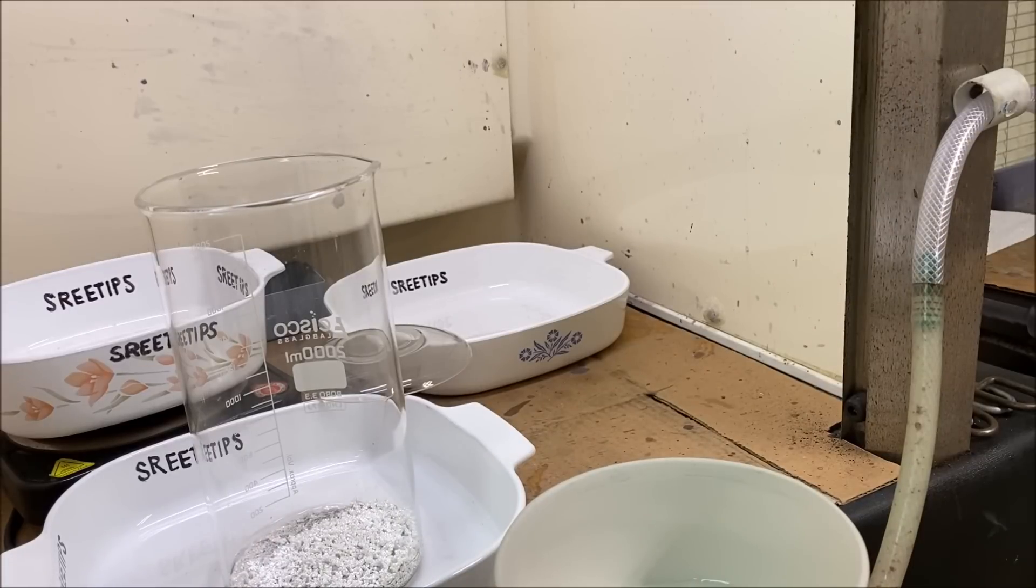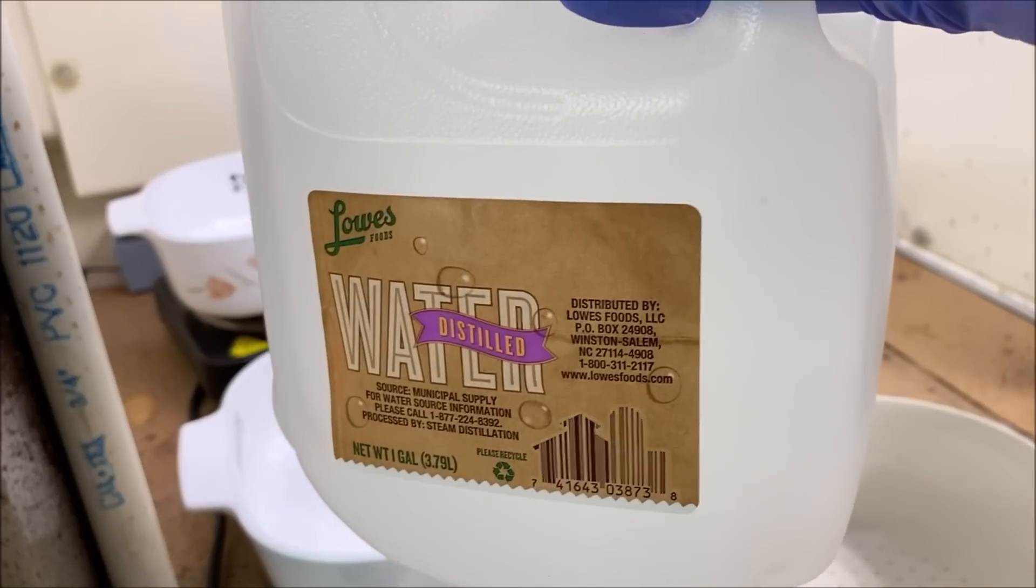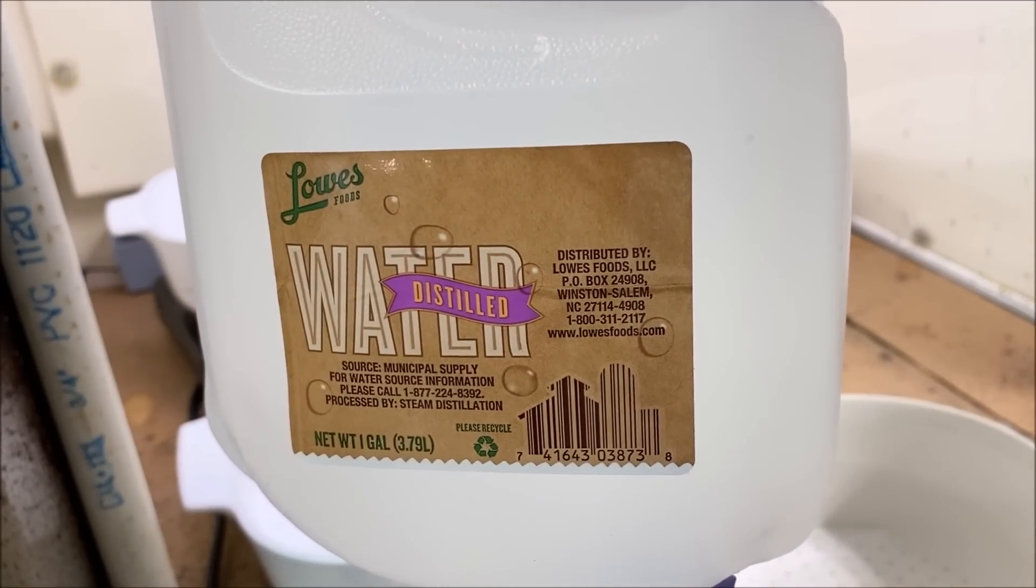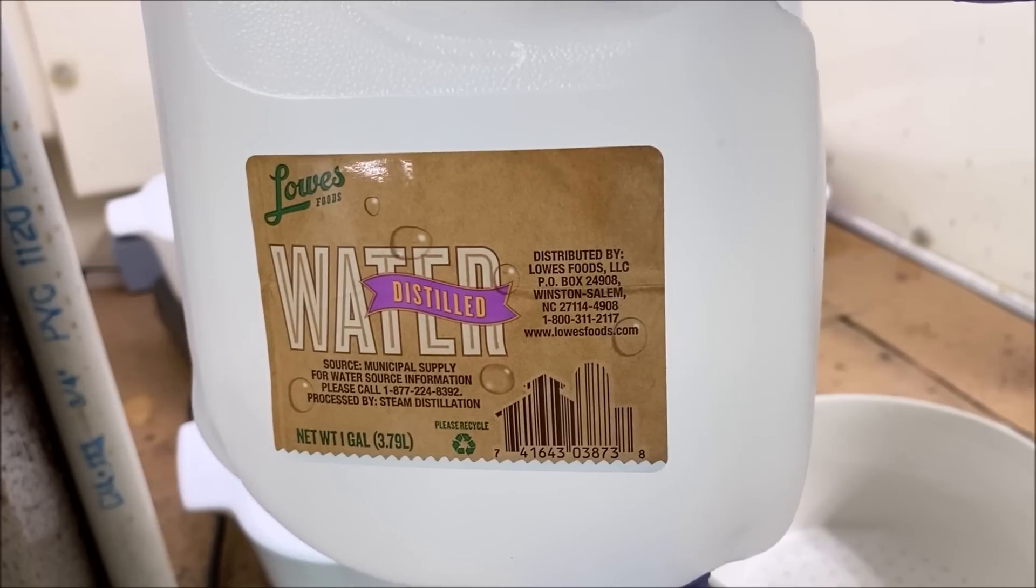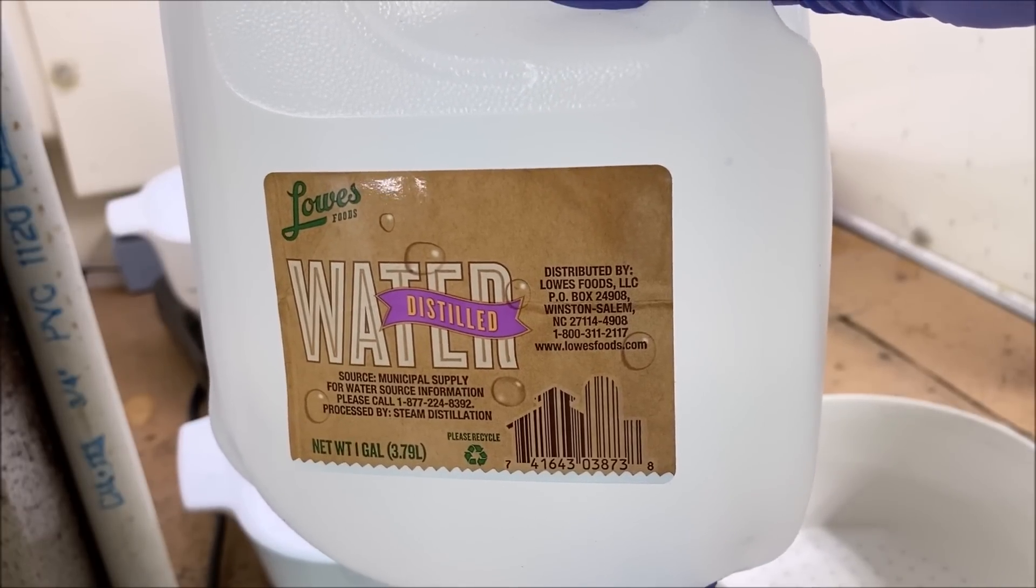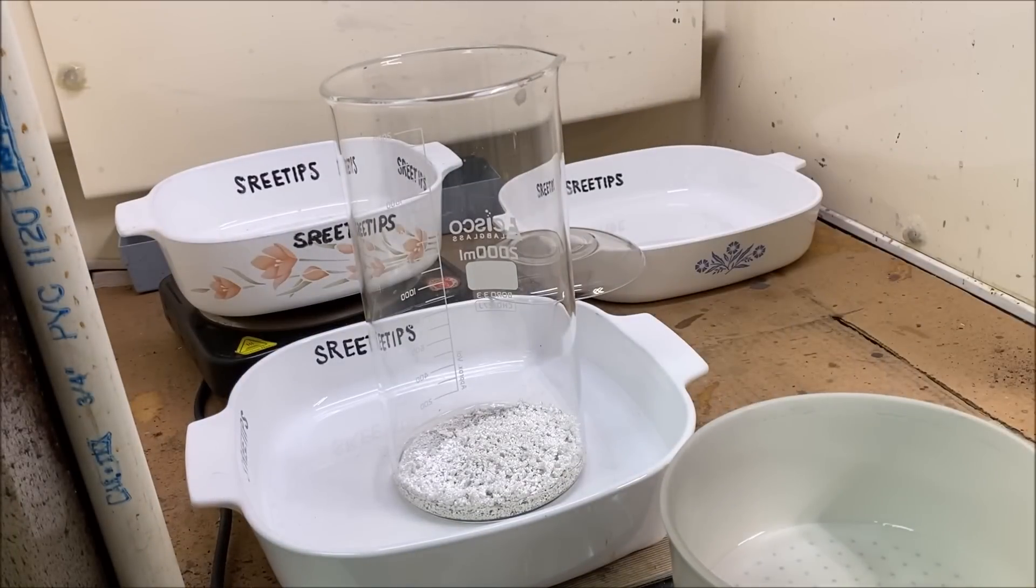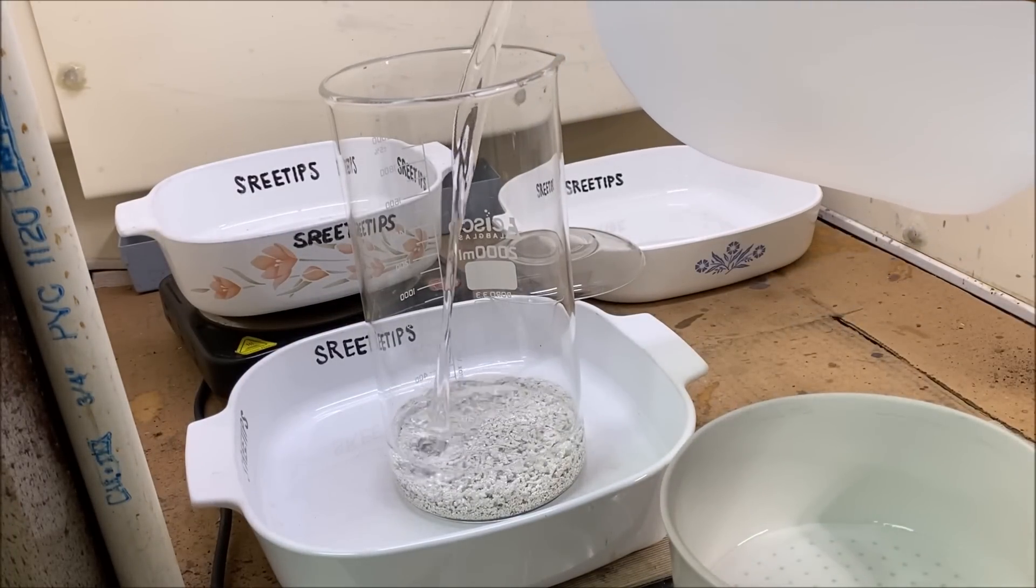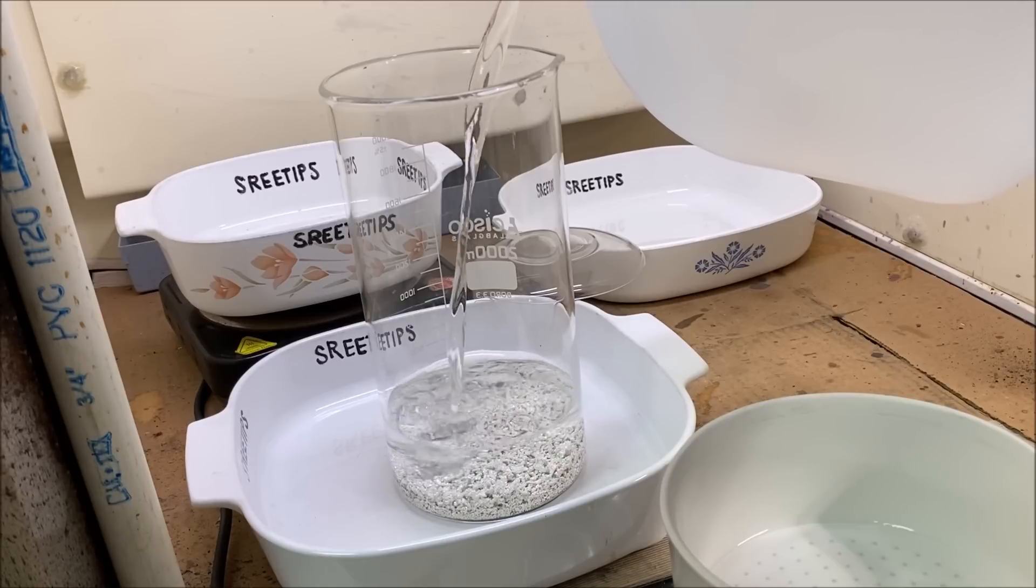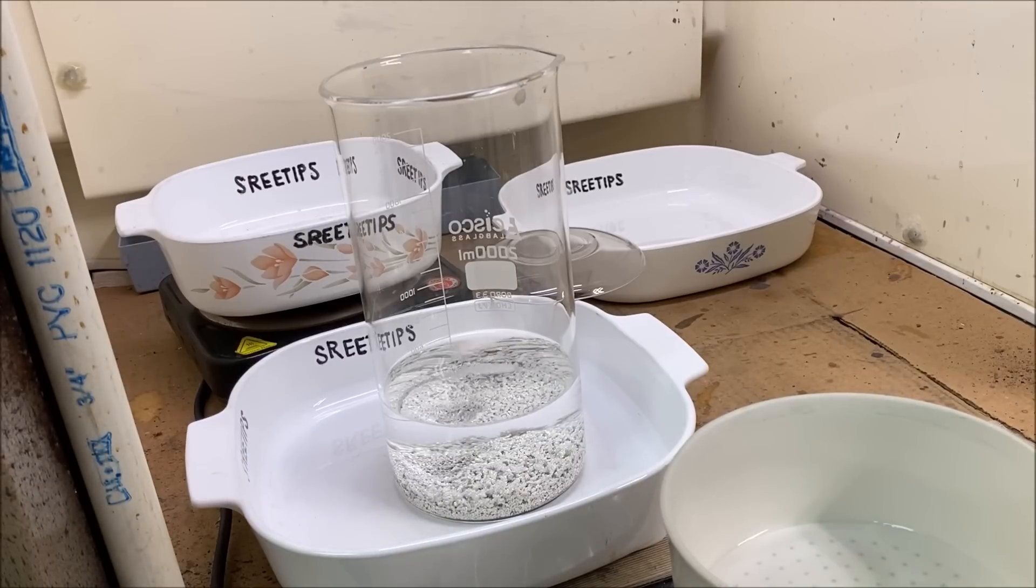Let's get this scale out of the way. Now what I'll do is add some distilled water. Got to use distilled water when working with silver. Tap water contains chlorine and the chlorine will instantly form silver chloride in this solution, so we've got to use distilled water. I filled it up to about the 600 milliliter level with distilled water, not tap water.